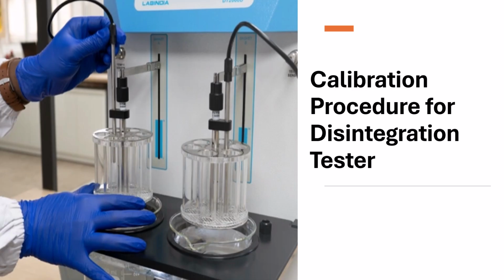So in today's video we will learn about the calibration procedure for the disintegration tester, and in my last video I have already covered the operation and other details of the disintegration tester, so you can refer to my last video for basics, right? The disintegration tester is used to determine how quickly a tablet or capsule breaks down in a liquid medium under standard conditions, and proper calibration ensures accurate, consistent and compliant results as per the pharmaceutical guidelines, right? So let's begin with the step-by-step calibration process.